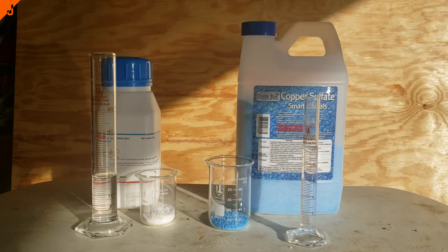Hello and welcome back to another video. In today's video, I'll be making copper-2-bromide from potassium bromide and copper-2-sulfate.